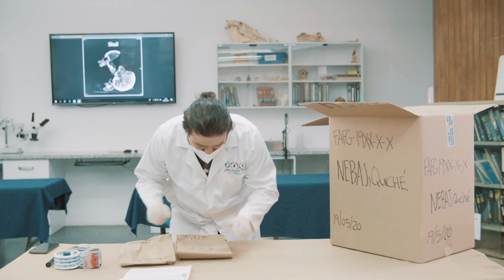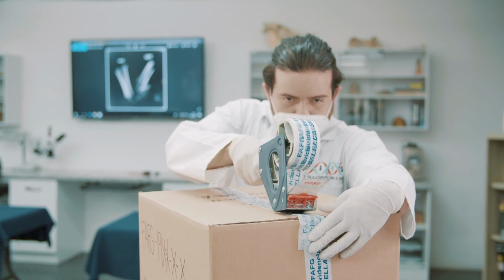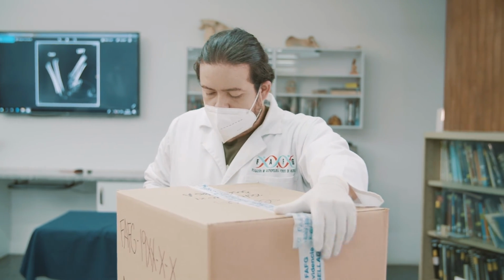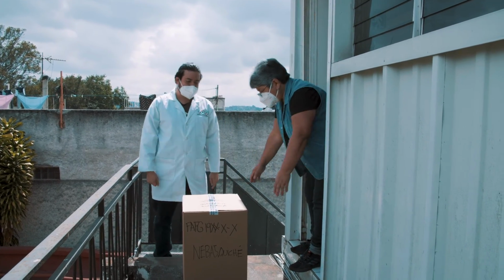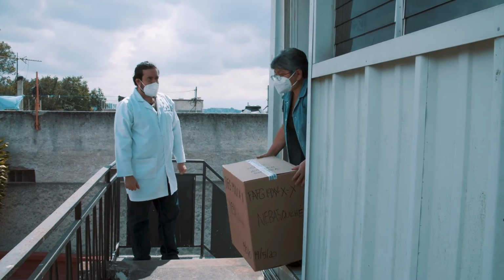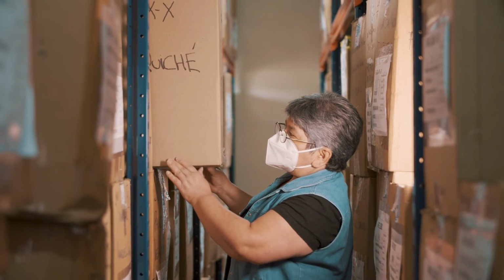They will then deliver a copy of all documents received with their respective stamps to be scanned and delivered to the evidence warehouse. Once the analysis process is complete, the skeletal remains and associated items will be packed. The box is sealed with evidence tape, dated and signed by the analyst, and then returned to the evidence warehouse.